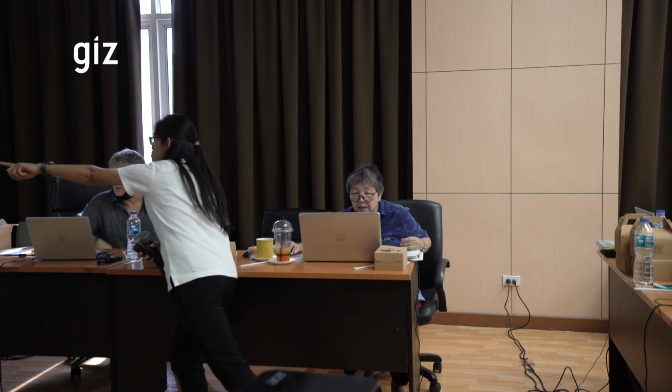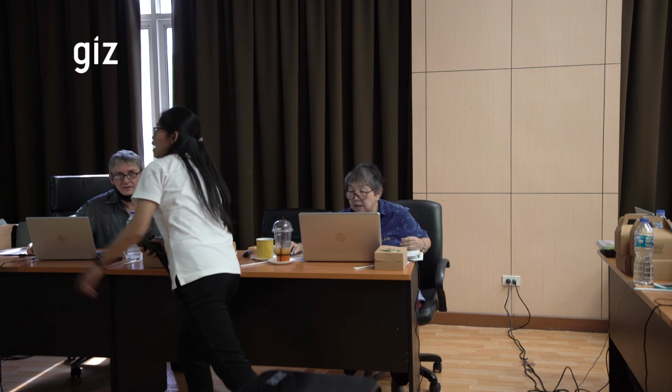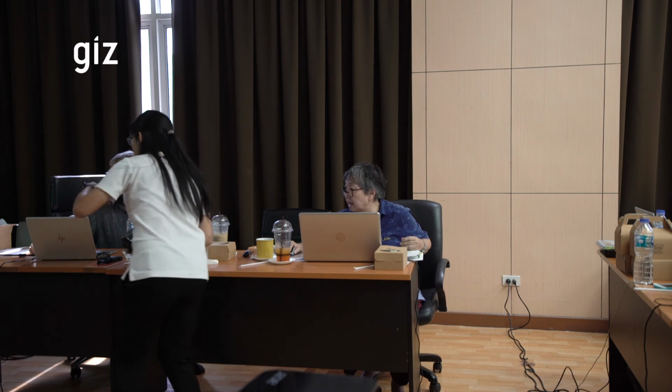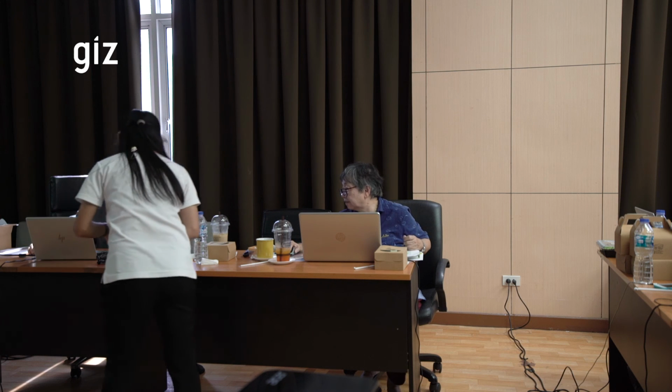Methane graph, please, methane graph. Nitrous oxide? Methane graph. This is the methane. This is methane, please see the methane graph. The graph.